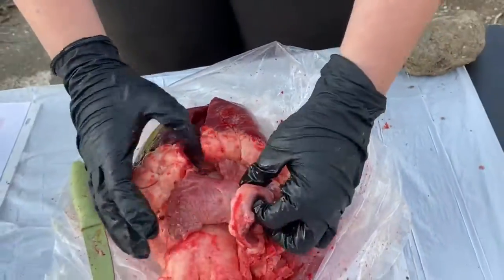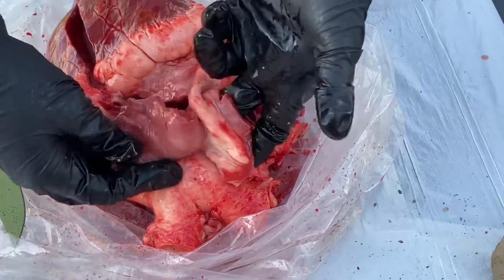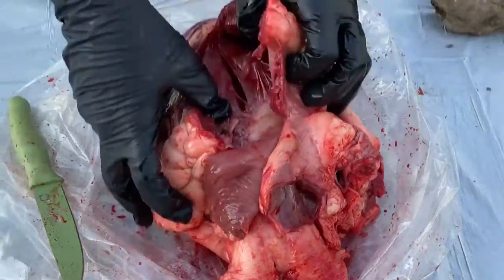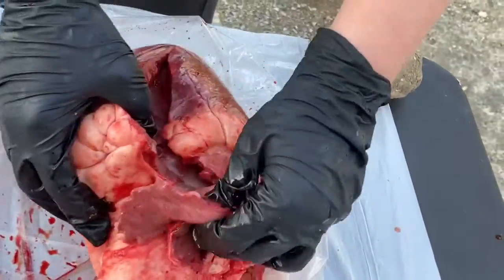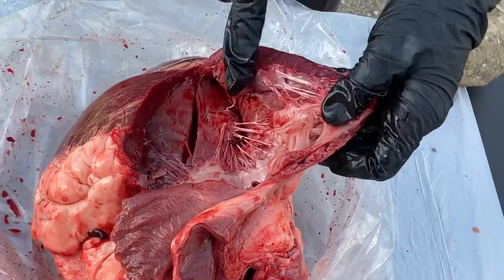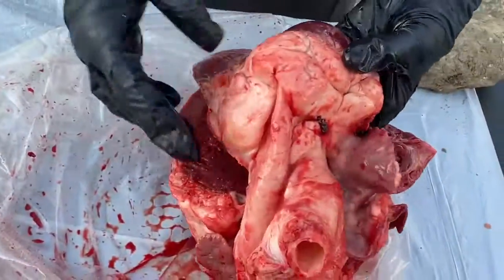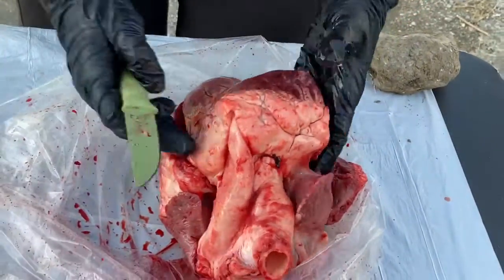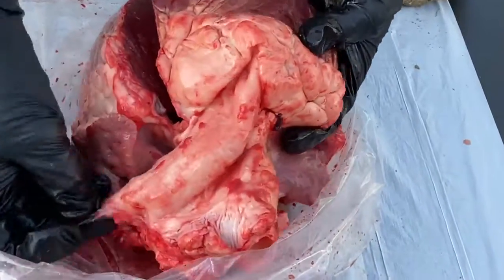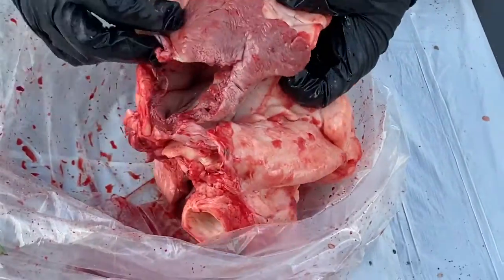Starting here, this would be one of the vena cava coming into the atrium, which are pretty small, and you can see what it looks like on the inside. Then it goes down, and there is a valve, but I think I cut through it, that goes into the ventricle. When you hear people talking about heartstrings, there really are strings in the heart that hold everything together. From there, and my finger's right there, this would be taking it to the lungs. So this is going to be one of the pulmonary arteries. It goes to the lungs, does its thing, comes back.